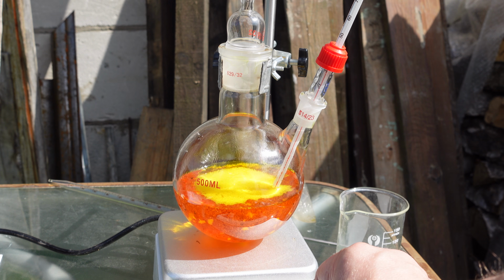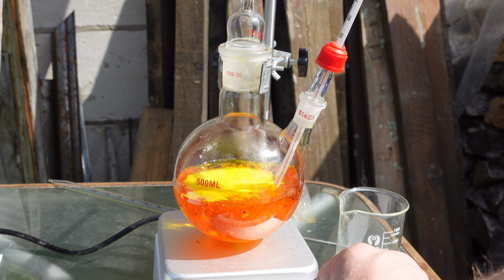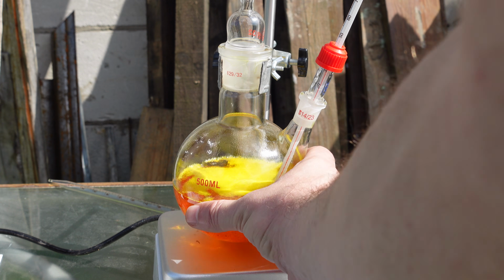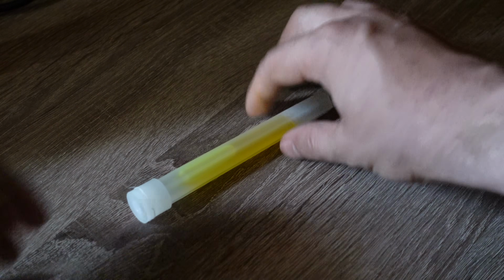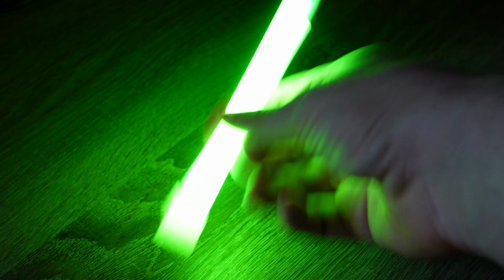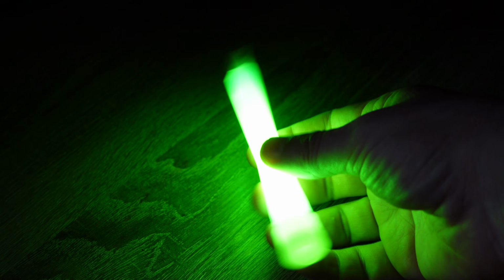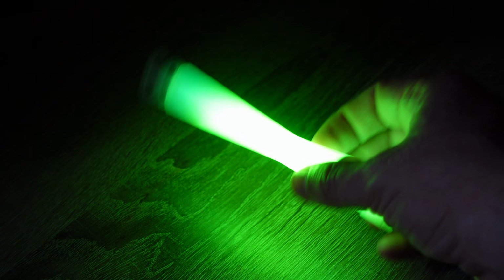It's not difficult, of course, if you work in a lab. If not, you might encounter some challenges. Try to find oxalyl chloride to start. I specifically synthesized the dinitrophenyl ester because it reacts the fastest, producing the brightest glow, although it's quite short-lived. In my opinion, for demonstrating chemiluminescence, the brighter the better, because if you want it to glow dimly for hours, you don't need to bother with synthesis. You can just buy a glow stick.